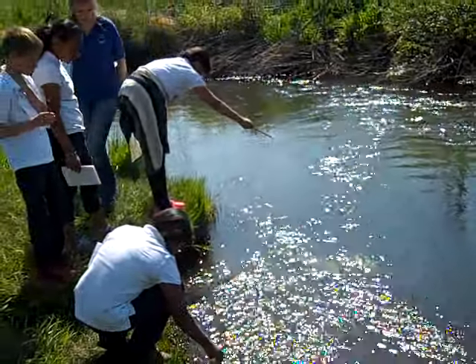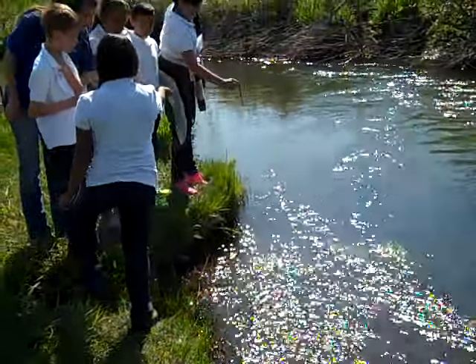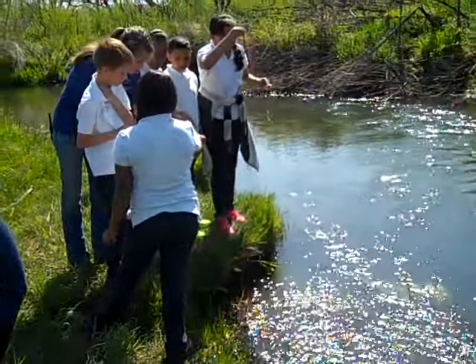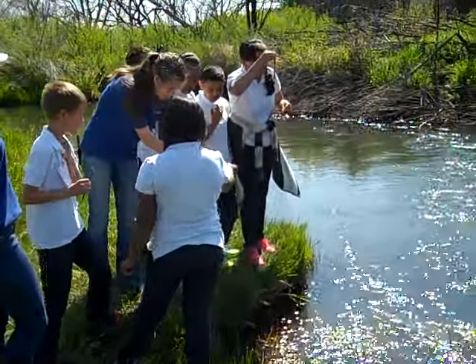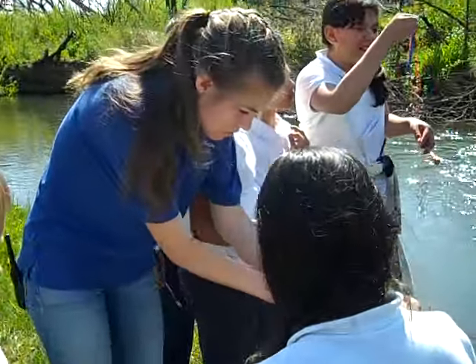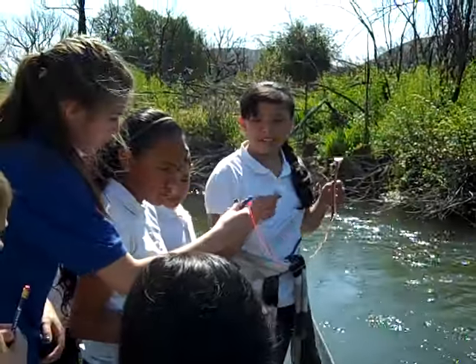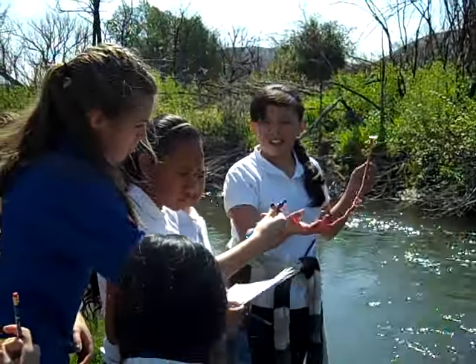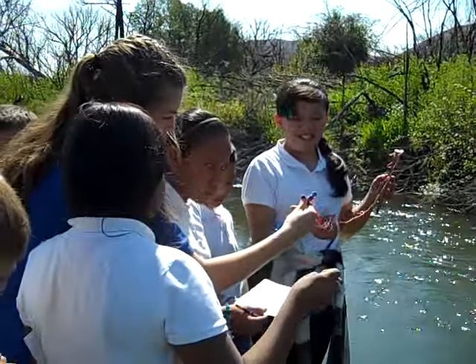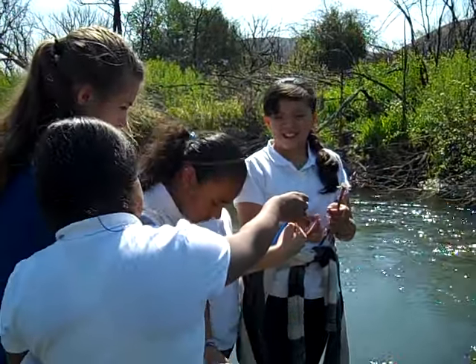You see what you guys got? Say about 14? 13, 14? How about that one? That one's about 16? Okay, 14 or 16-ish.